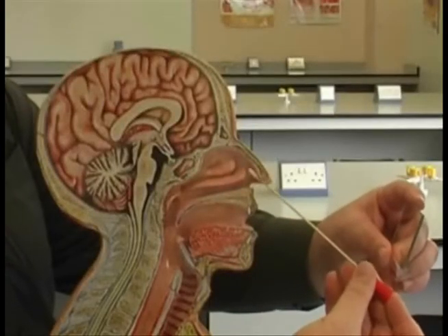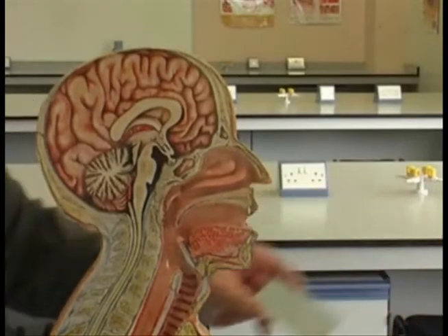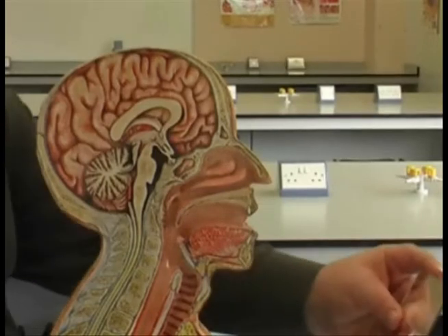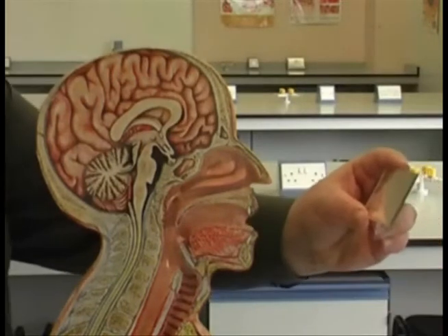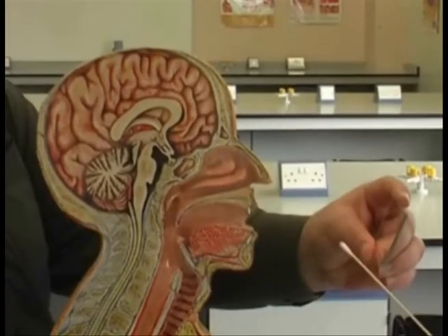For illustration, the anatomy department has kindly allowed us to use the sagittal section to show how best to take swabs from your nose and throat. Firstly, throat swabs should be very carefully taken as going too far back into the throat is likely to trigger the gag reflex and result in a mess. Instead, take the swab back as far as is comfortable and with a twisting motion, collect your sample.